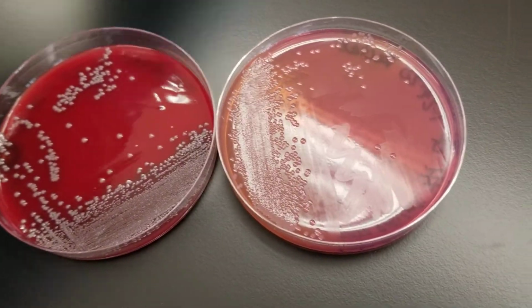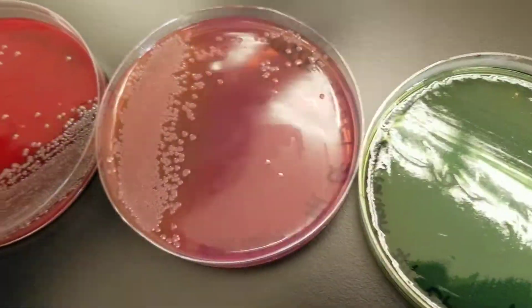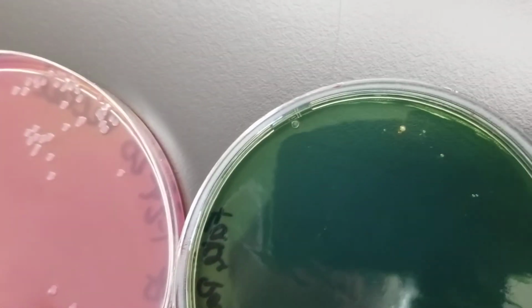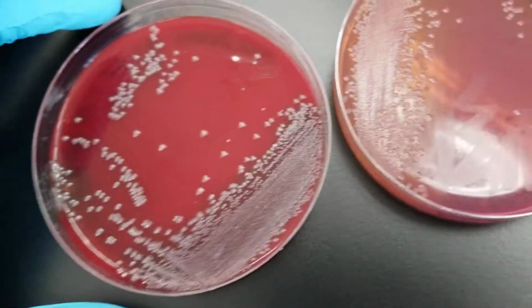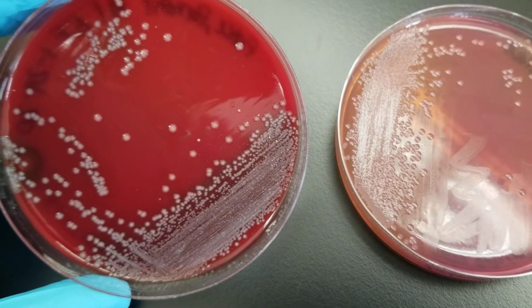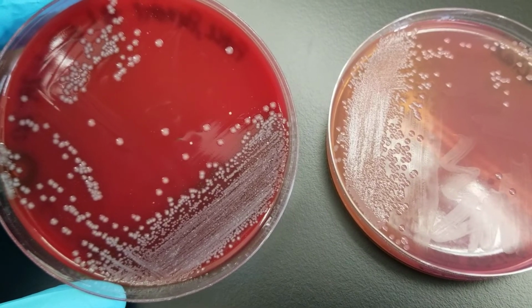And this is exciting. This is a different person. All right. And this one has a really great result as well. There's one little guy over here pretty much growing on the Hektoen enteric agar, and the rest of it is over here. And this totally makes sense. We've got, looks like a little bit of skin normal flora also on here.